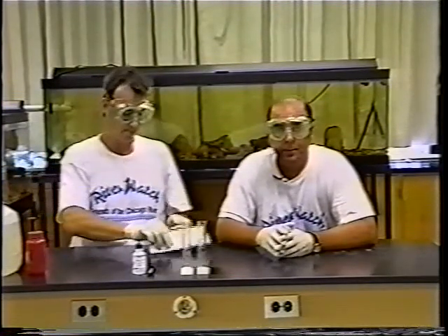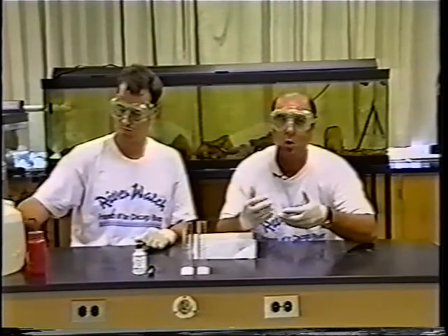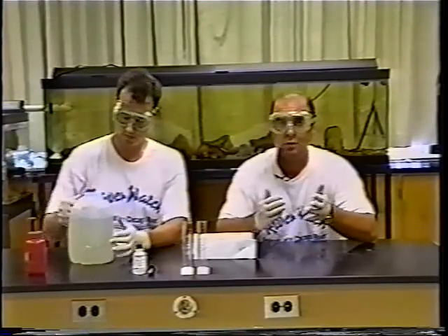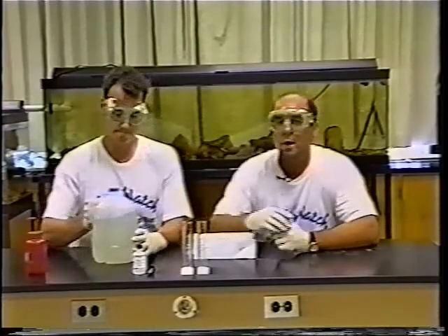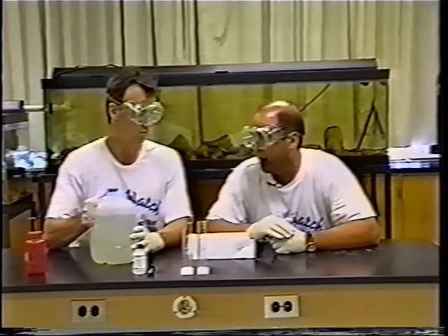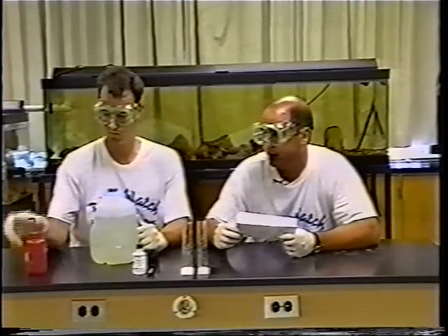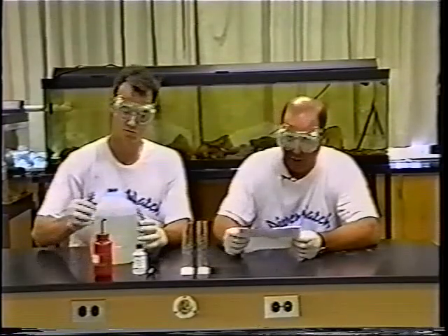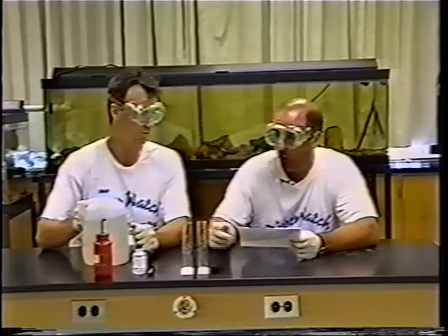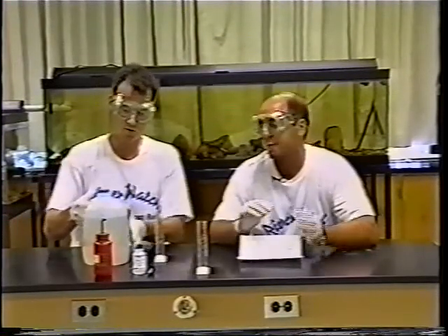Since you are in the turbidity group, you need to collect your water as one of the first groups — you do not want anyone getting into the river and stirring up the bottom or changing the turbidity from what it actually is when flowing. You'll get your water sample from the river, and you'll also need a bottle of deionized water. The first thing to do is fill one of the columns with 50 milliliters of river water.